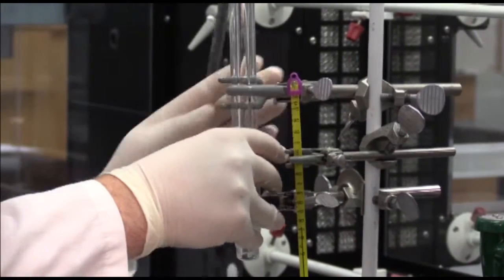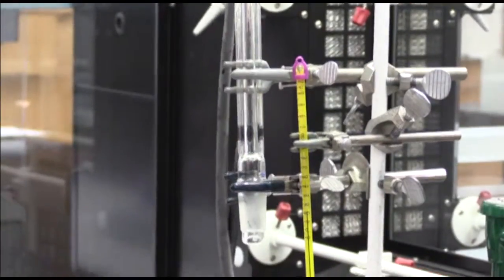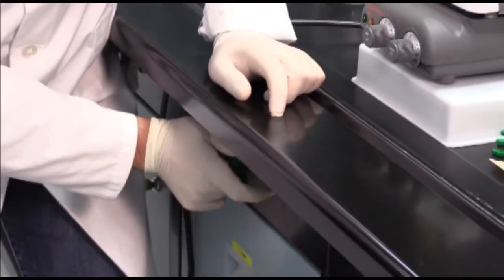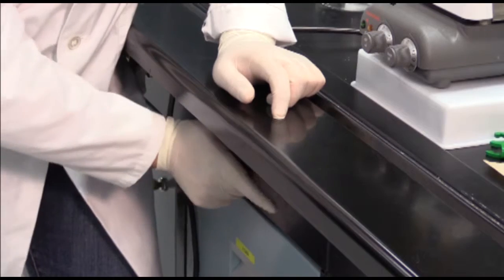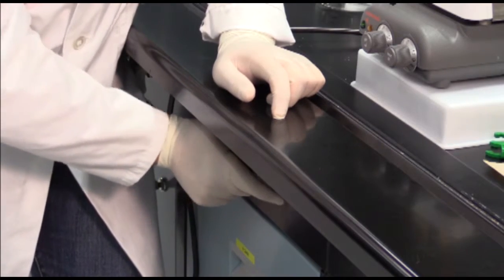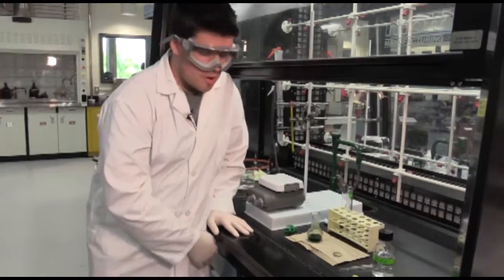Once you've done that, you can go back to the water knob and turn off the water.